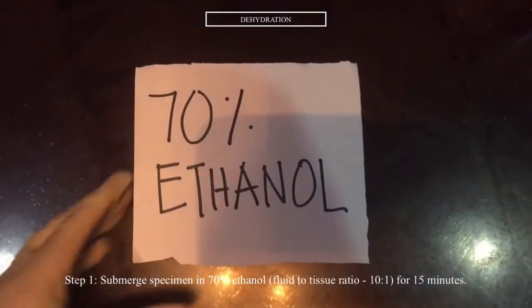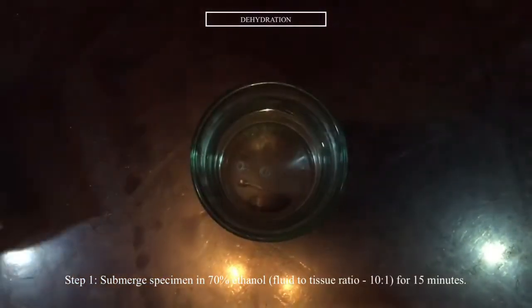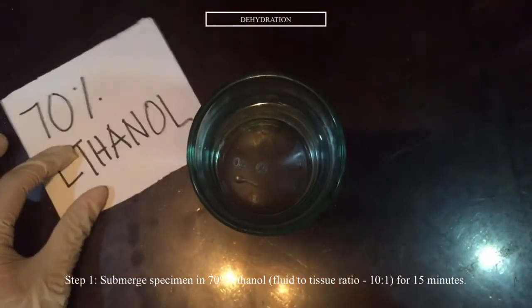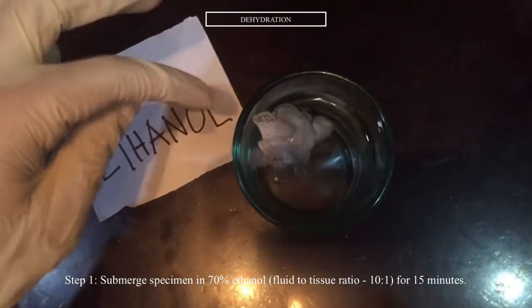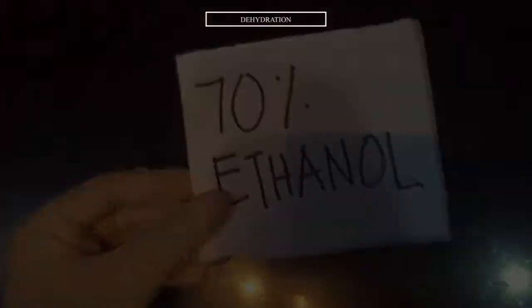So for the first step of dehydration, we are going to submerge our sample in a lower concentration of dehydrating agent, and in this case, 70% ethanol. So we submerge our sample in 70% ethanol for 15 minutes.